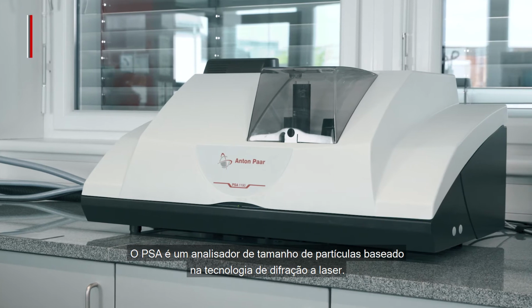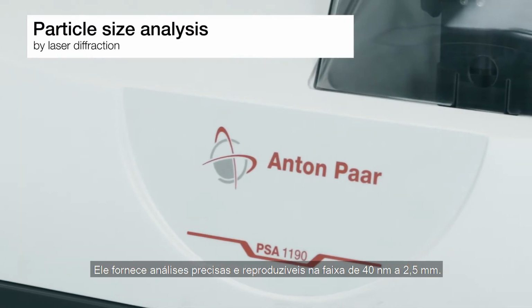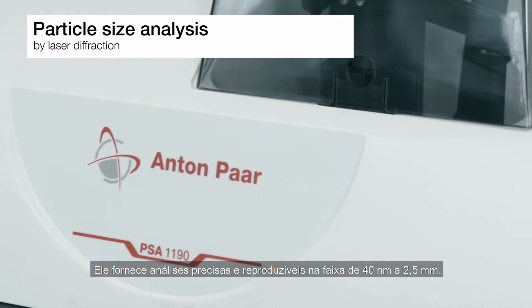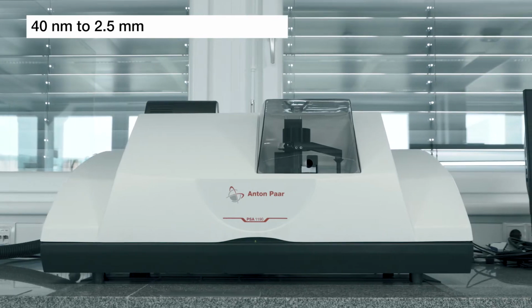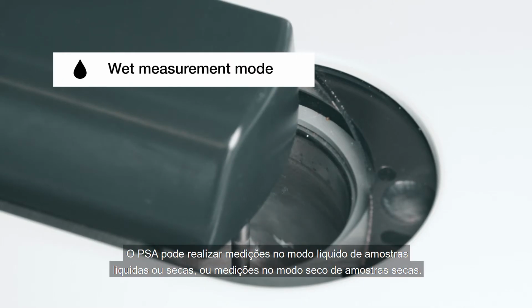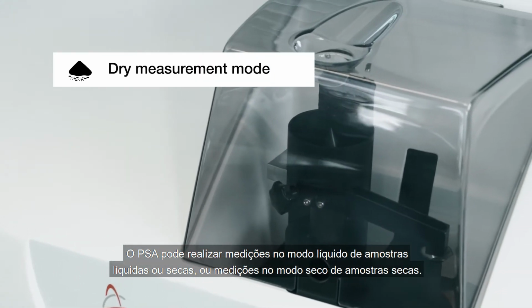PSA is a particle size analyzer based on laser diffraction technology. It provides accurate and repeatable analysis in the range of 40 nanometers to 2.5 millimeters. PSA can perform wet measurements of either liquid or dry samples, or dry measurements of dry samples.